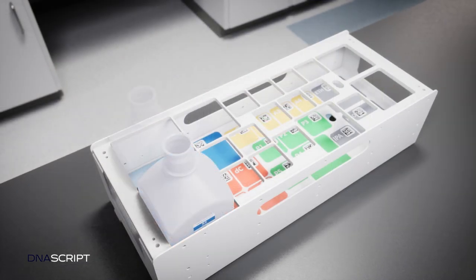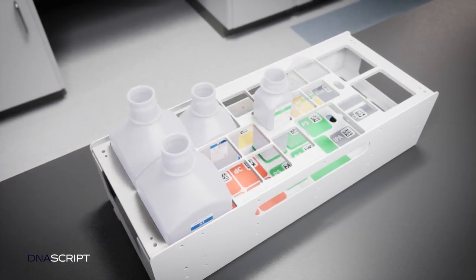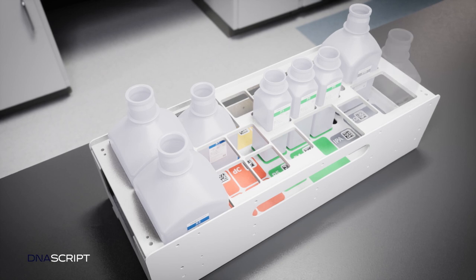Each reagent is scanned and loaded into a color-coded space in the reagent tray to ensure correct placement.